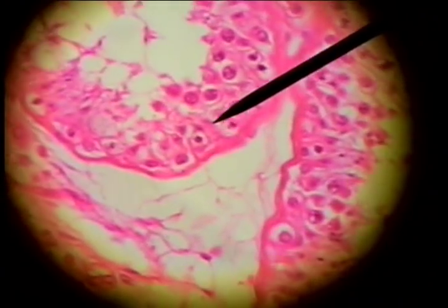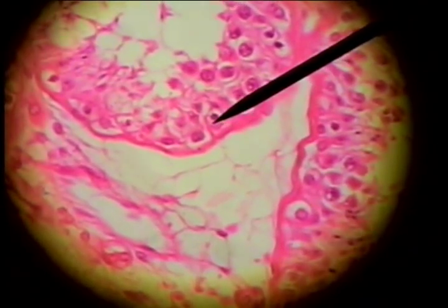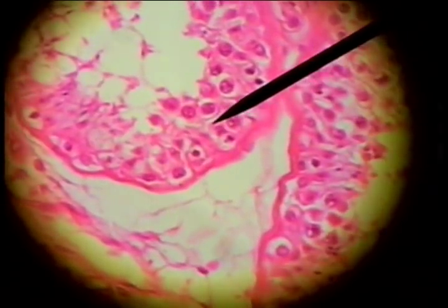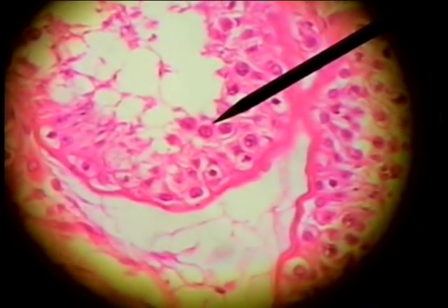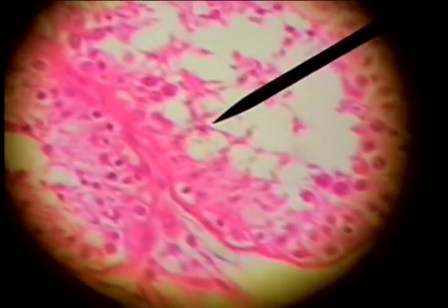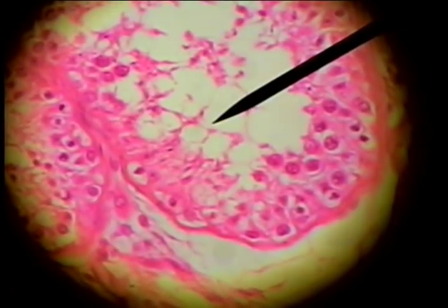Just inside the connective tissue wall is the Sertoli cell with a dark nuclei. And these cells are the reproductive cells — spermatogonia here and here — which mature as they move toward the center and become spermatids. The spermatid will then form the sperm. Here's the head of a sperm, and you can just barely see the tail of the mature sperm.